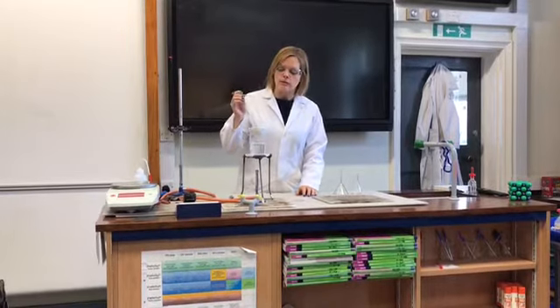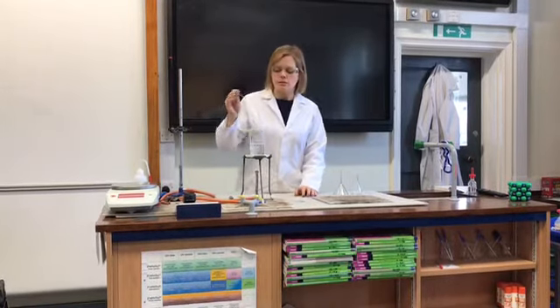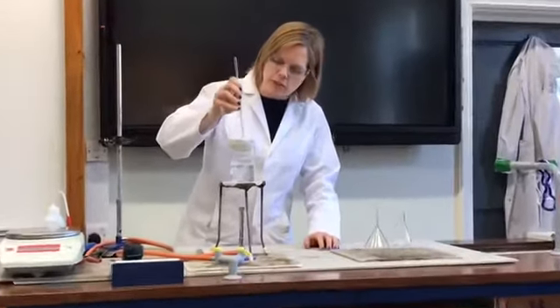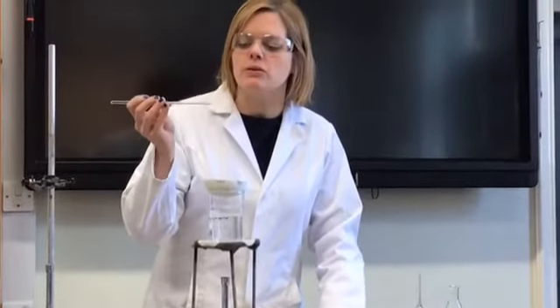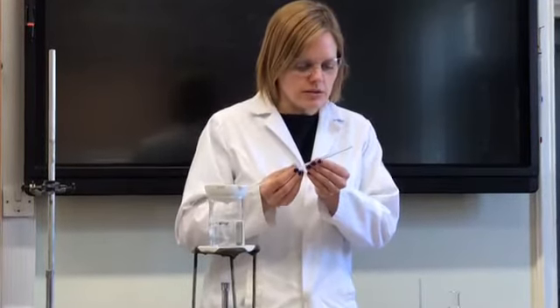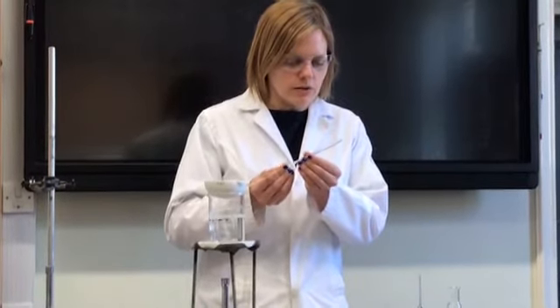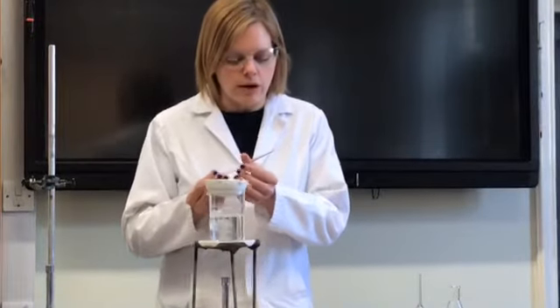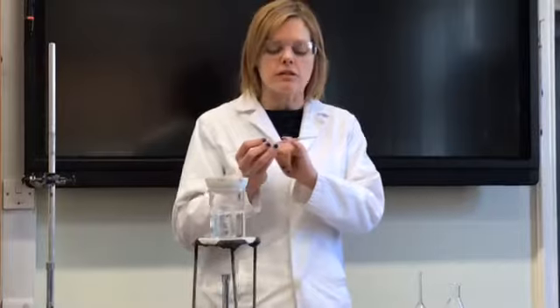So this has been heating for quite a while now, probably about 15 minutes, 20 minutes perhaps, and I can just start to see some crystals forming around the side of this evaporating basin. So we'll just dip this stirring rod in again and have a little close look at that. It just seems to be starting to form some crystals, or some solid sodium chloride on the ends of that cold stirring rod—remember because the solubility is lower because the temperature is lower on the stirring rod than in the bulk of that solution.